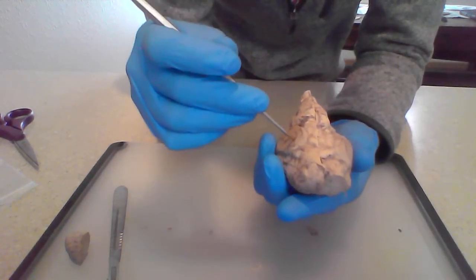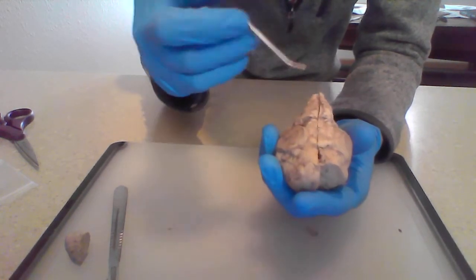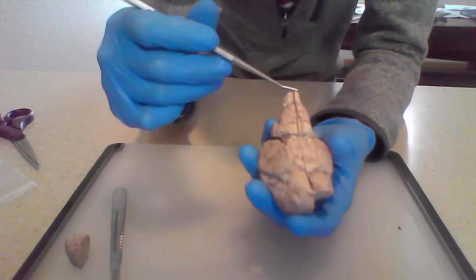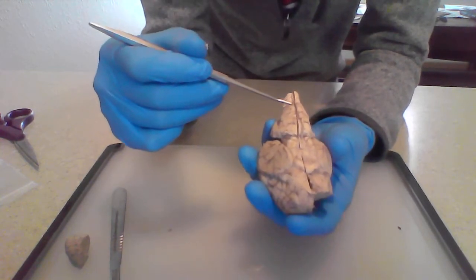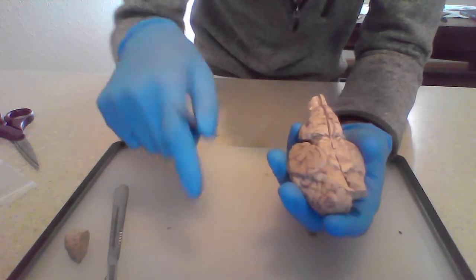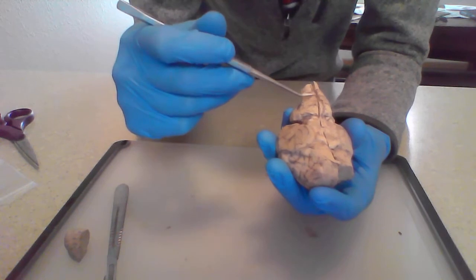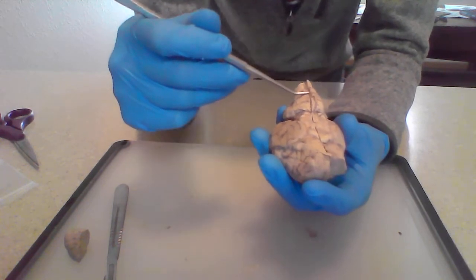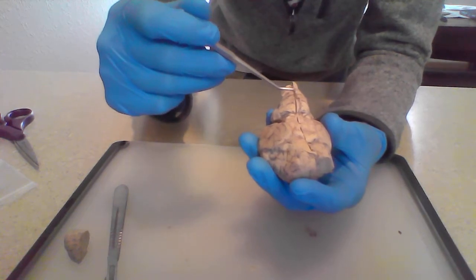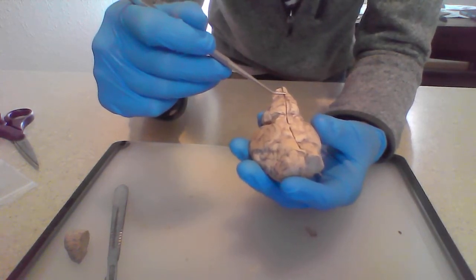Okay. And then on the ventral side, we have several structures. We've got the brainstem and the spinal cord here. Spinal cord is right down here, leading up to the brainstem, which is the medulla and the pons. Now, the medulla is this first lump here, and that is largely in charge of maintaining your heart rate, your blood pressure, things of that nature.